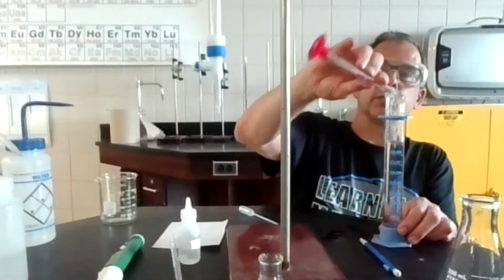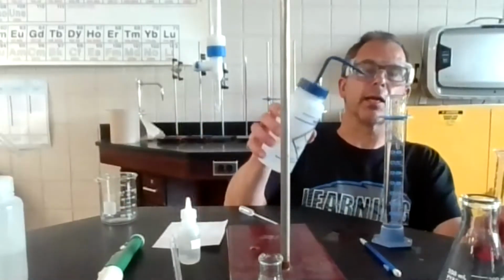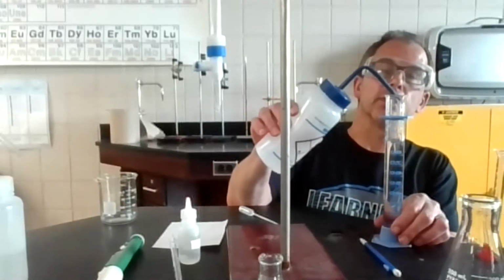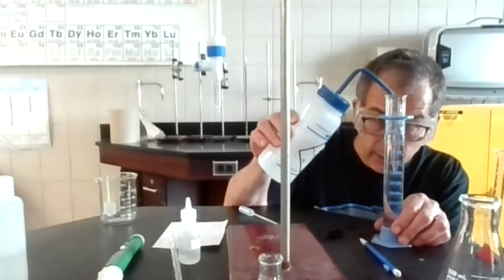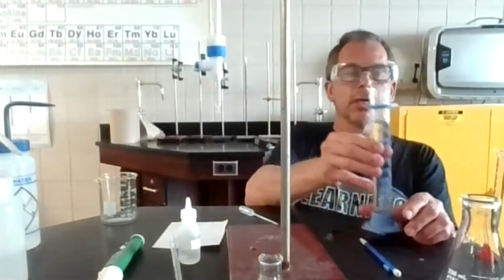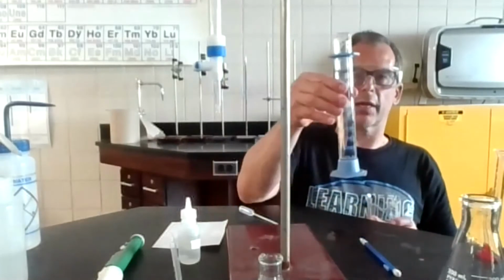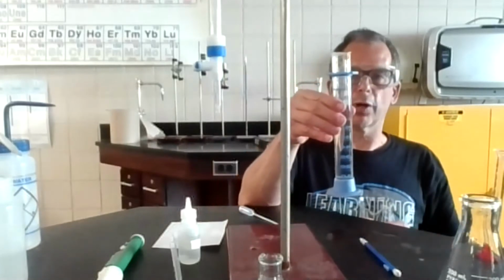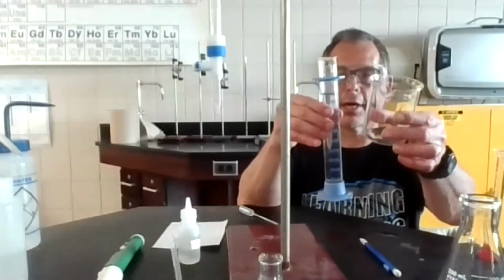I know it's not mixed super well, but now I'm thinking I got pretty much all the base out of here. You certainly could do one more rinse if you felt like you needed to, but I think that's pretty good. And then I'm going to go up to the 100 milliliter mark. So I measure that up to 100 milliliters. Then I have a beaker that I rinsed out. This one I left a little water residue on because we were adding water. But this other one I rinsed out because I don't want to add water to it, and I dried it.